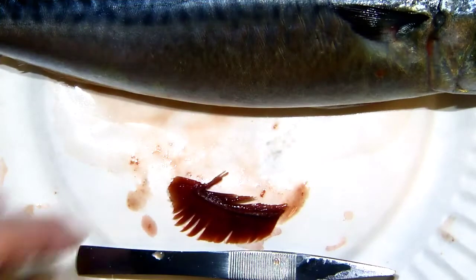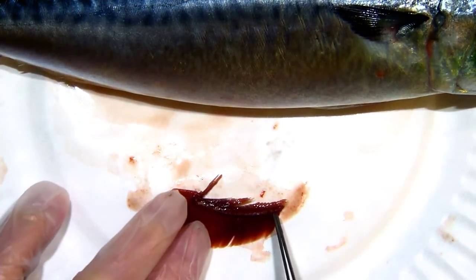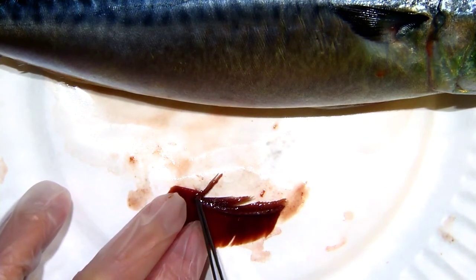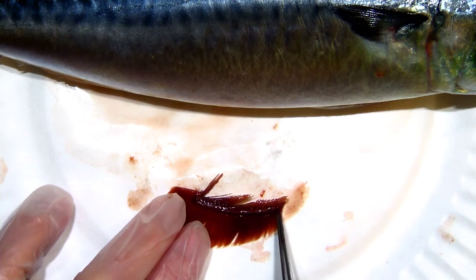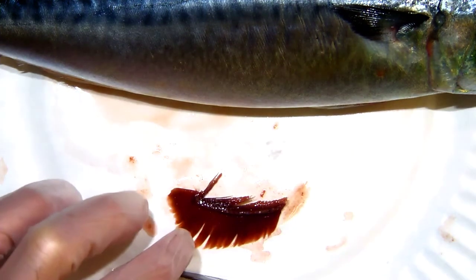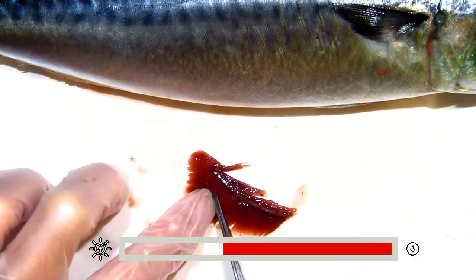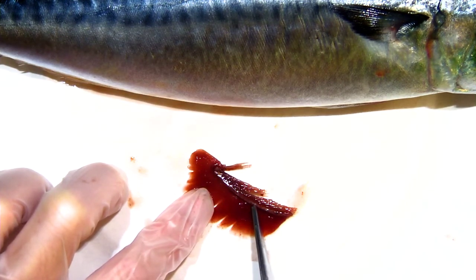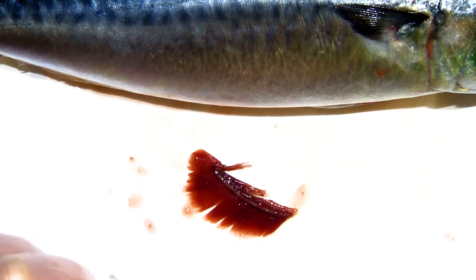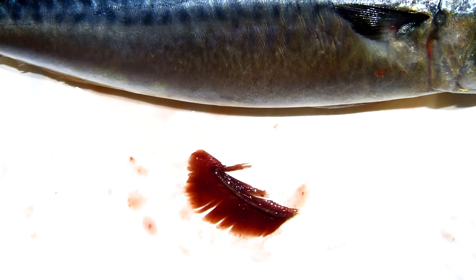Let's get back to our mackerel. The last bit of the gill I want to look at is called the gill arch — this line right here. This line is just structure. It gives the gills structure so they don't just ball up, because we definitely don't want the gills to ball up. We want a lot of water flowing through them, and that arch gives it that structure to do so.